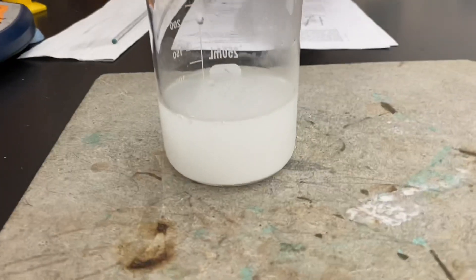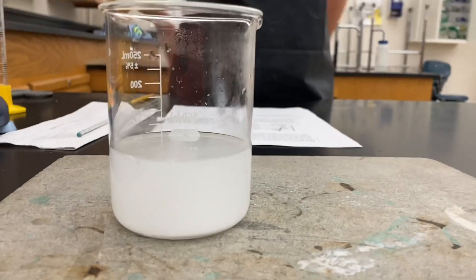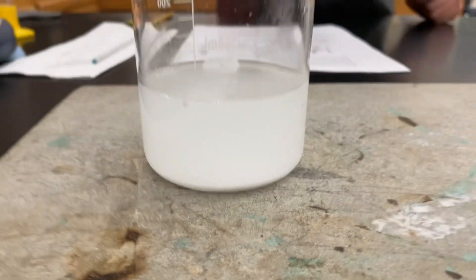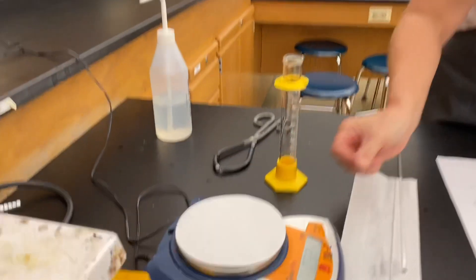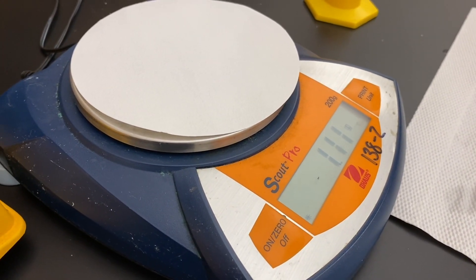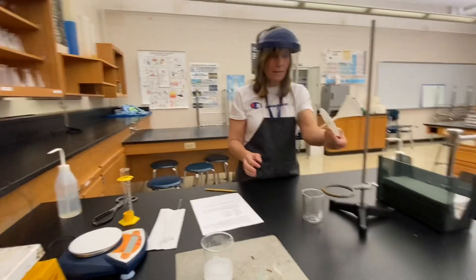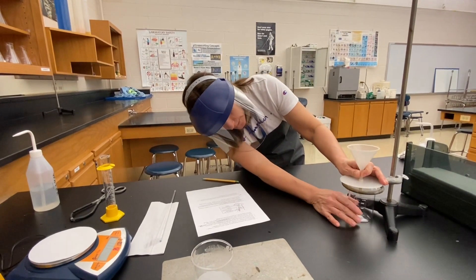On step eight: I've turned off the hot plate and we're going to let the solid material settle to the bottom of the beaker. While that sits, I need to mass a piece of filter paper on the balance — the filter paper weighs 1.11 grams. Make sure to record that. Next I want to get my setup ready: I have a ring stand with a ring, a funnel and collar, and beaker one is placed underneath to catch the filtrate.